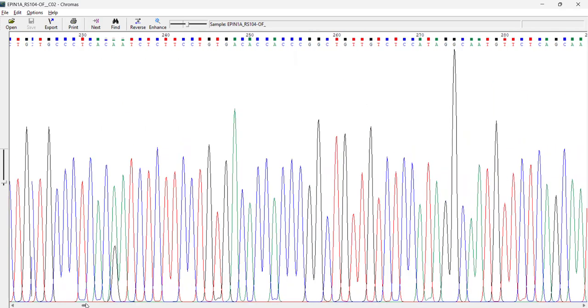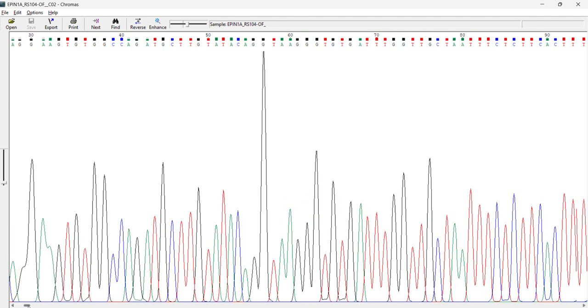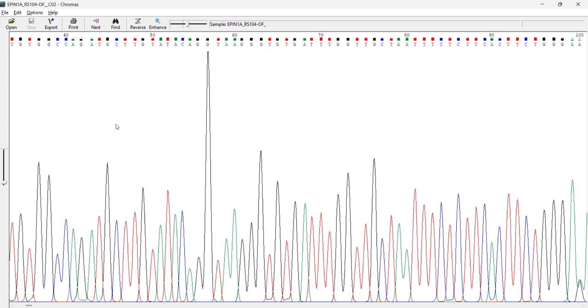Okay, and in the starting also you can see there is some noise, I think around the first 20 to 30 bases. This comes due to the dimer and all. So we need to be checking it after 20 base pairs. Okay, 20 to 30.